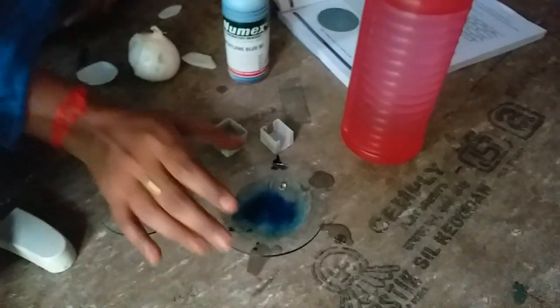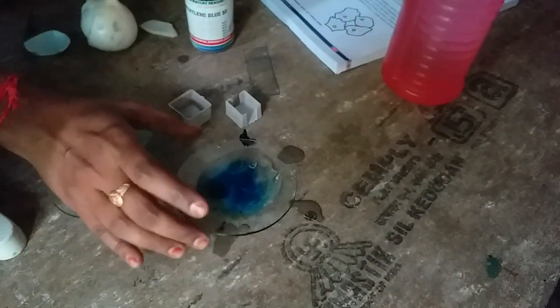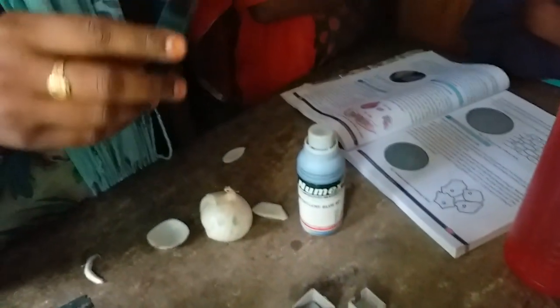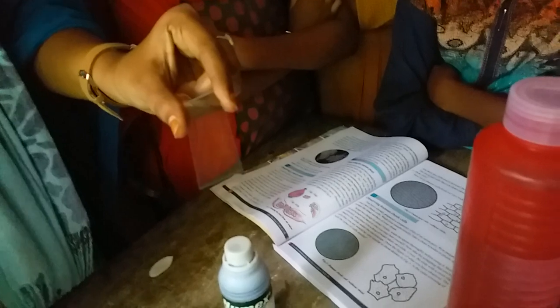We should leave this for two minutes. After that we have to take this onion peel and place it on a clean slide.